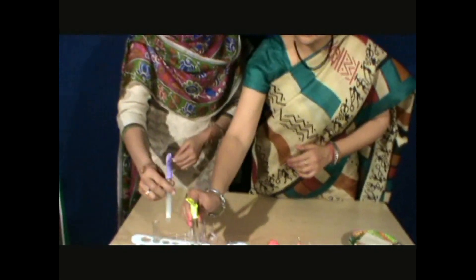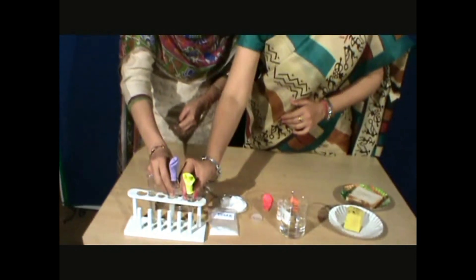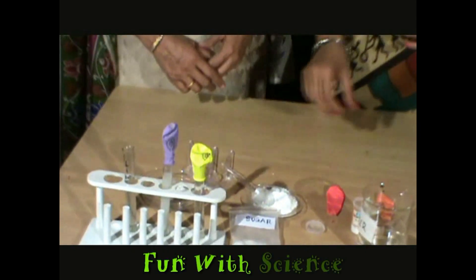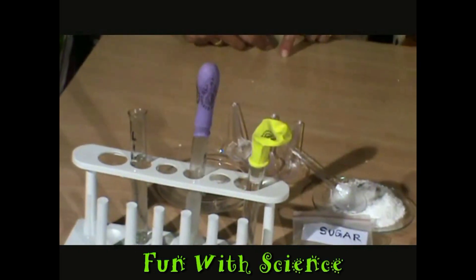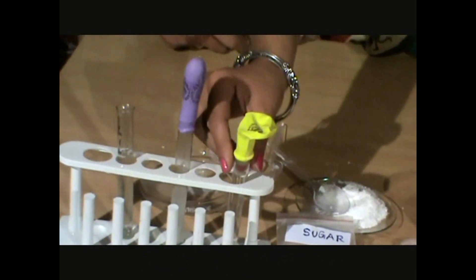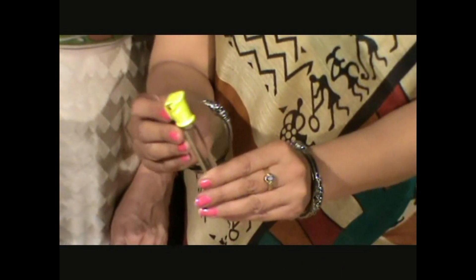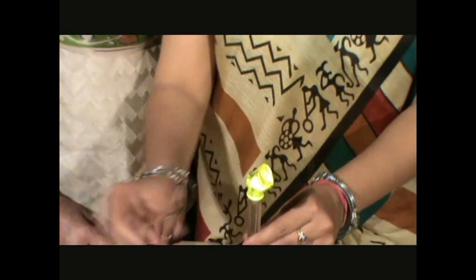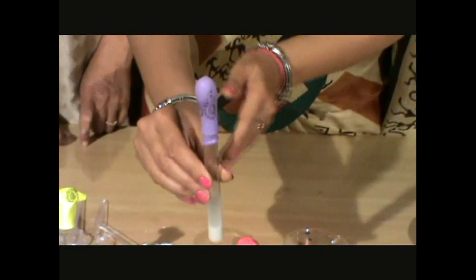We will leave this in a warm place for a few days, but avoid direct sunlight. This apparatus has been kept for one day, and after one day I am observing that in test tube B the balloon has not inflated at all.